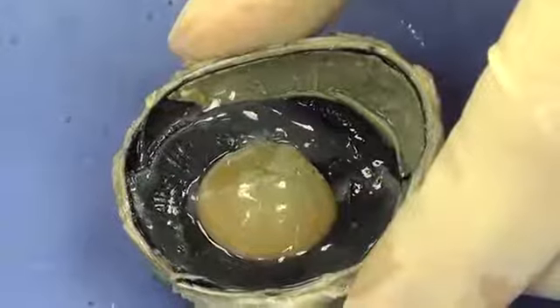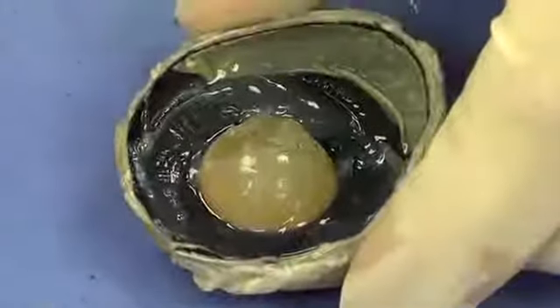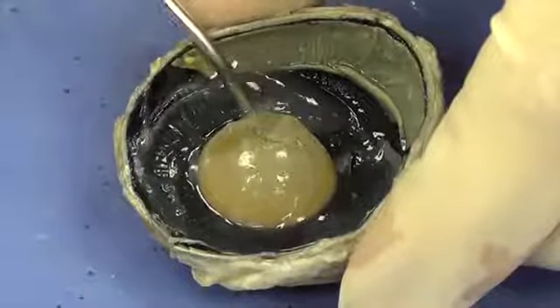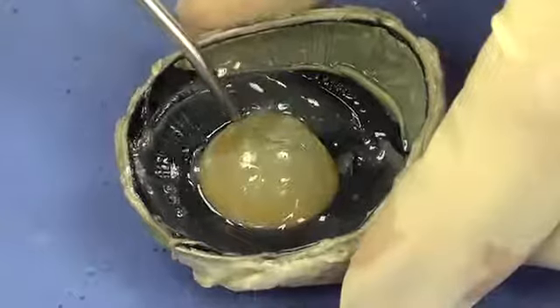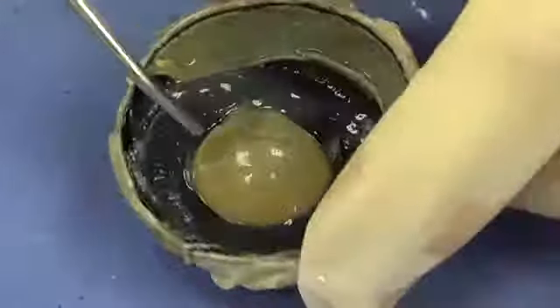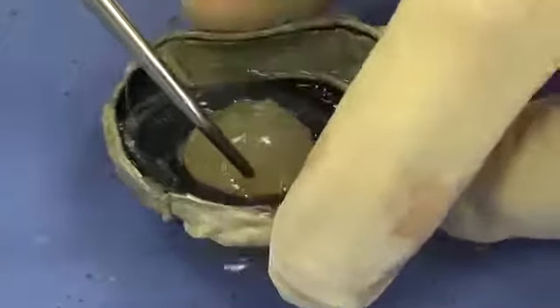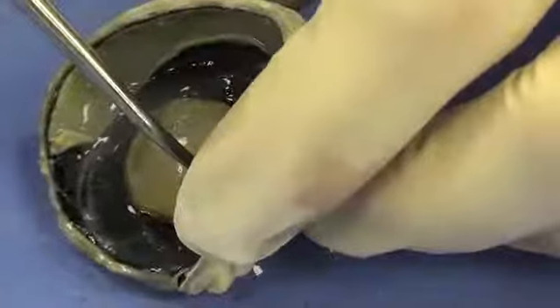If we look close or if we look far away, that ciliary body is going to contract accordingly and change the shape, either flatten the lens out or make it more spherical like it is right now. I'm going to slowly remove the lens, and as I do, we're going to see if we can see where the ciliary muscle is actually attached to the lens.